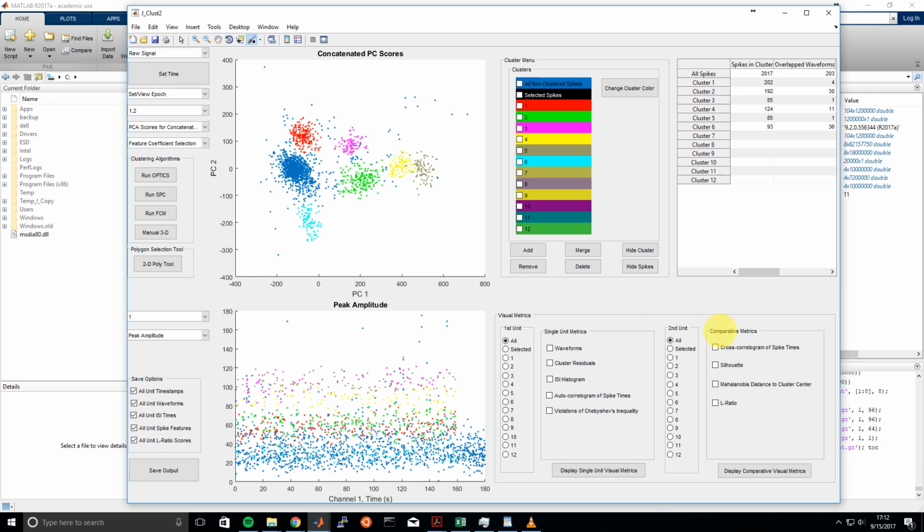Then I'll also spend some time going over comparative metrics, which can be used to compare two units side by side. And I'll go over the visualizations J_Clust2 uses, which is unique to the spike sorting program, and which a lot of other spike sorting softwares out there don't have in their package.